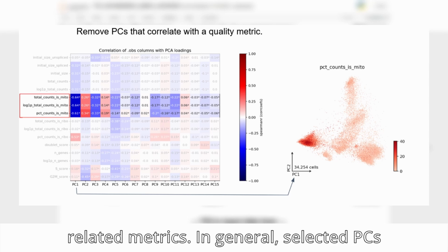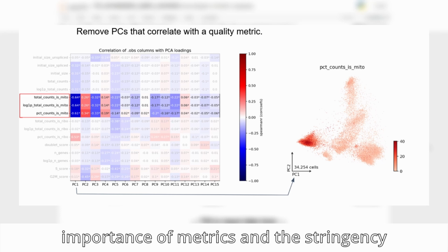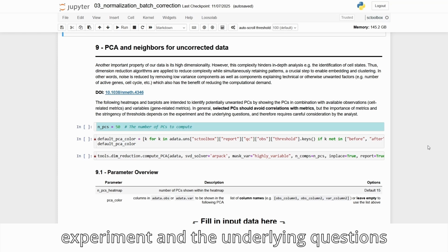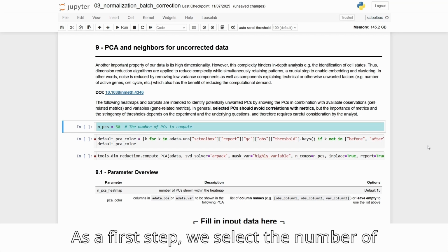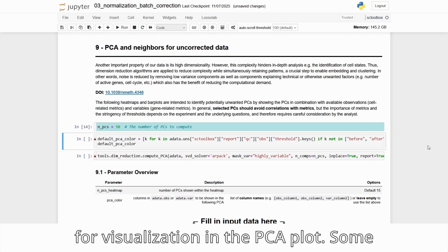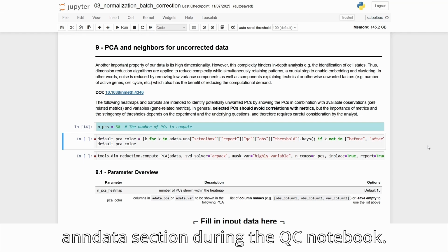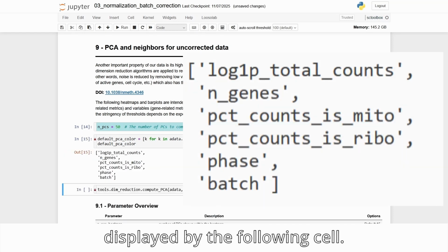In general, selected PCs should avoid any correlations, but the importance of metrics and the stringency of thresholds depends on the experiment and the underlying questions, and therefore requires careful consideration by the analyst. As a first step, we select the number of PCs to compute and the default metrics for visualization in the PCA plot. Some of these metrics were saved in the anndata.uns section during the QC notebook. We choose the default metrics, which are displayed by the following cell.